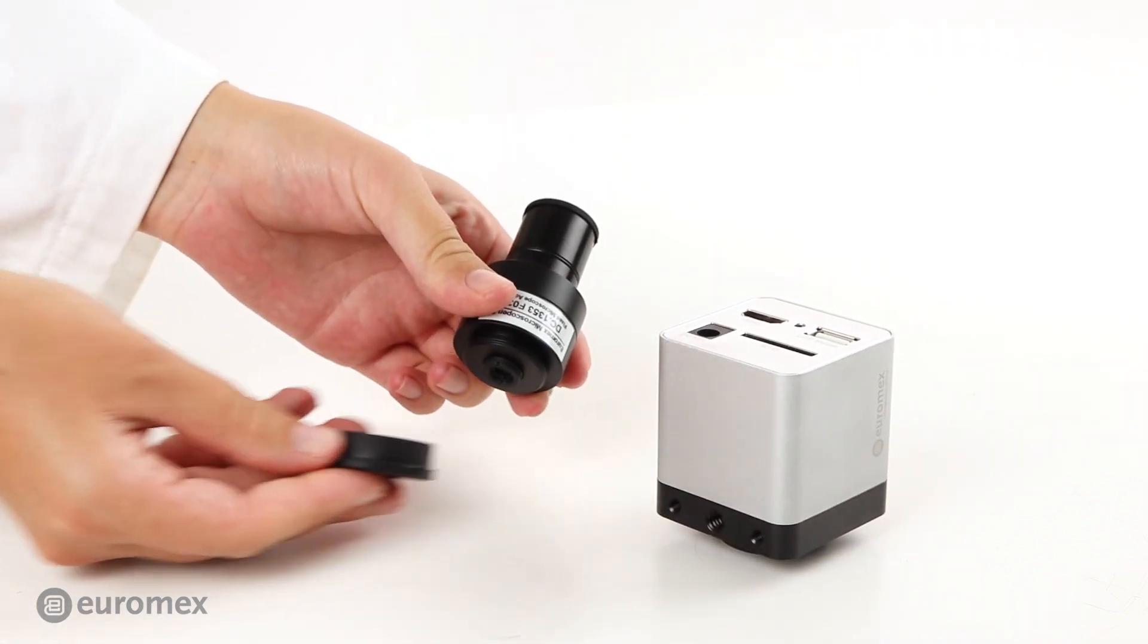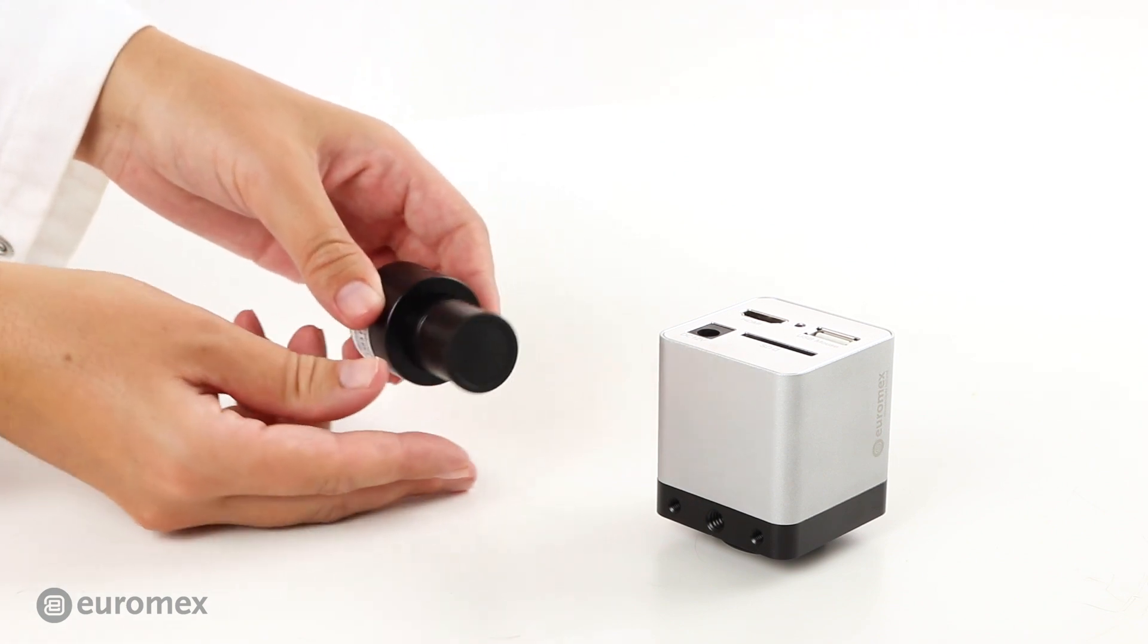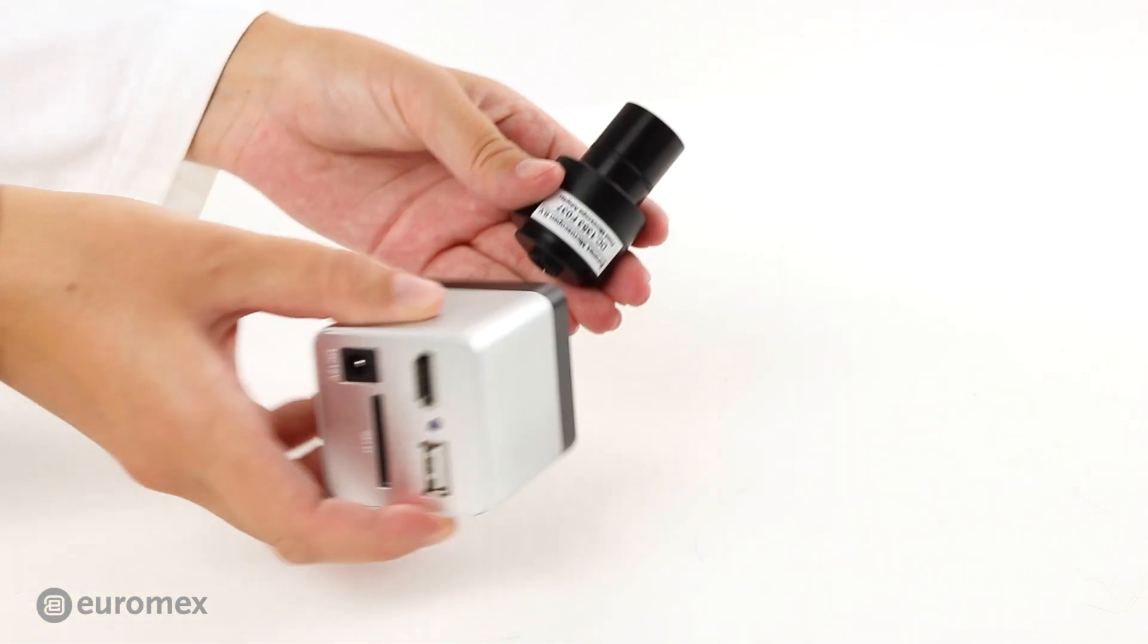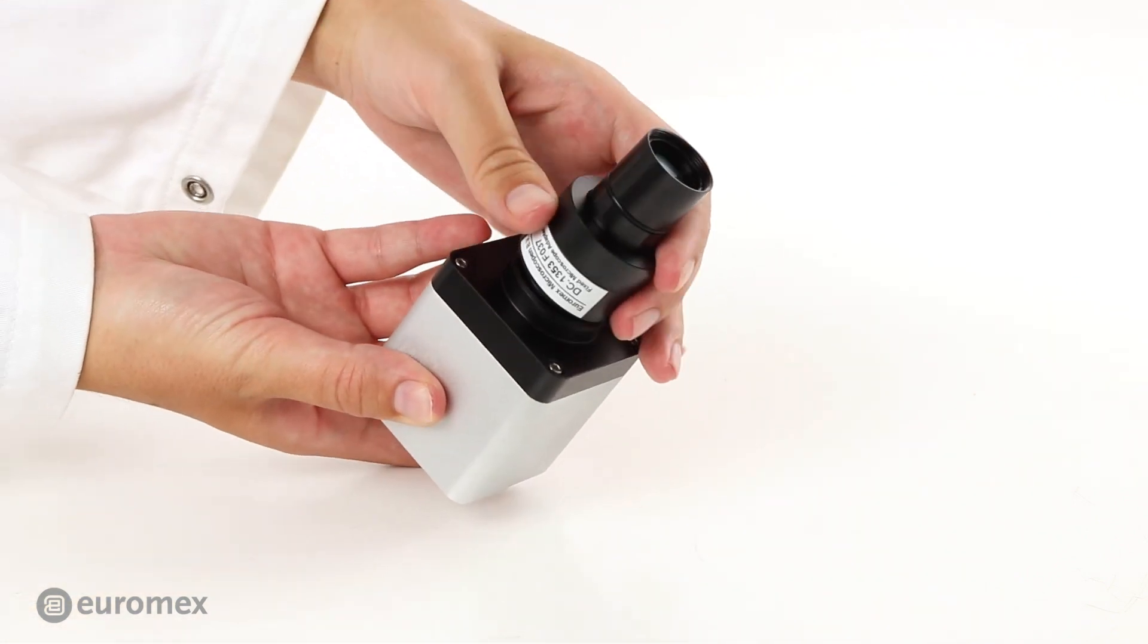Remove the caps from the standard C-mount adapter, then attach the C-mount adapter to the camera.